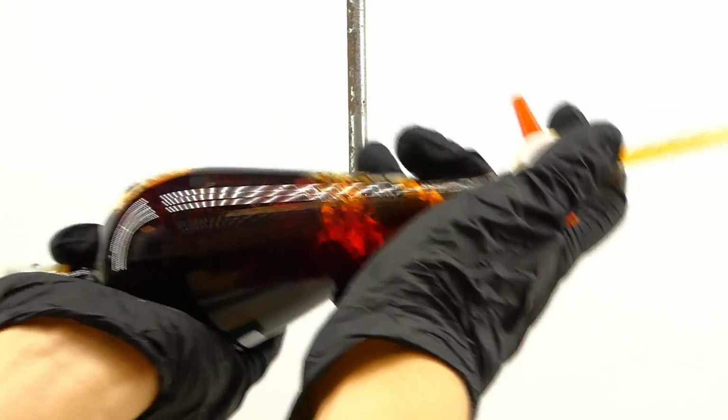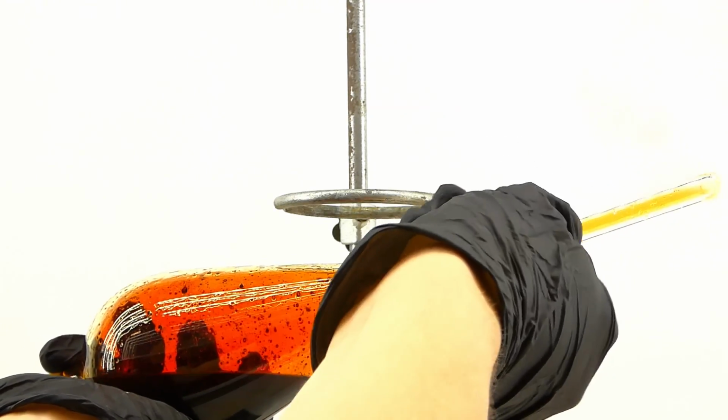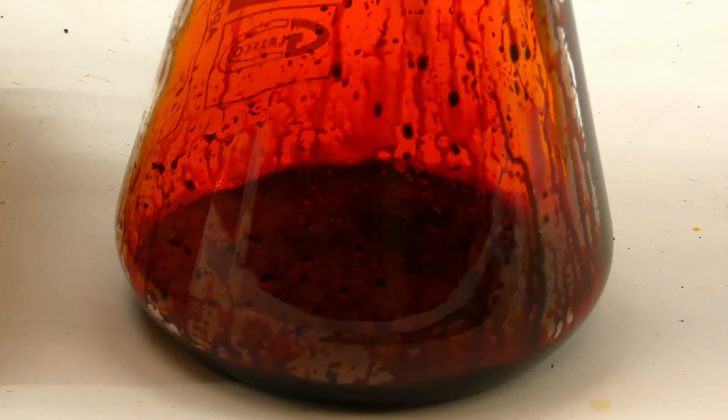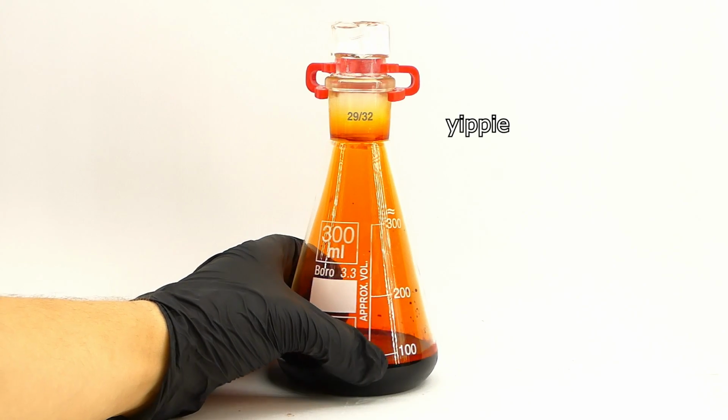I washed the bromine by gently shaking it with the sulfuric acid, and frequently venting the funnel to prevent a disaster. When I was done, I got the now dry bromine into a flask, and before purifying it further, I had to do everything again.